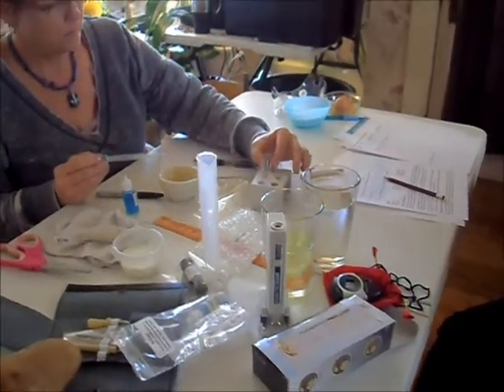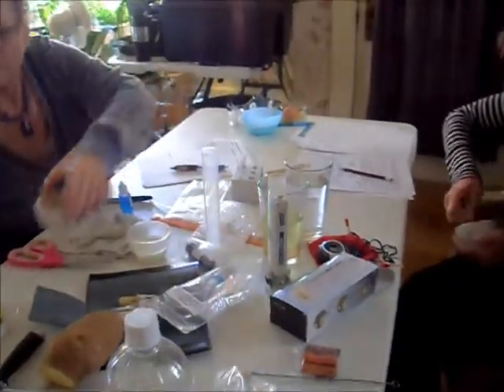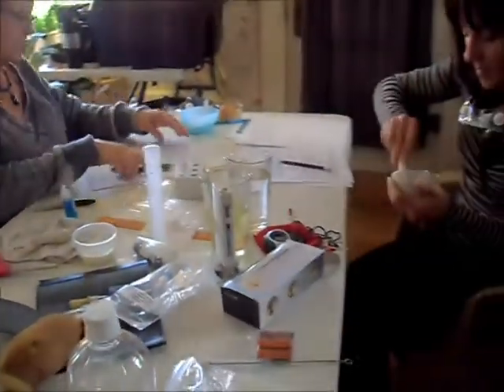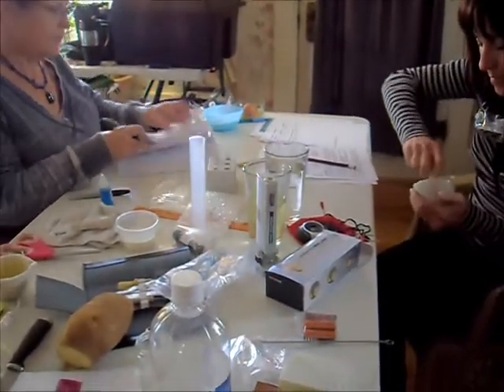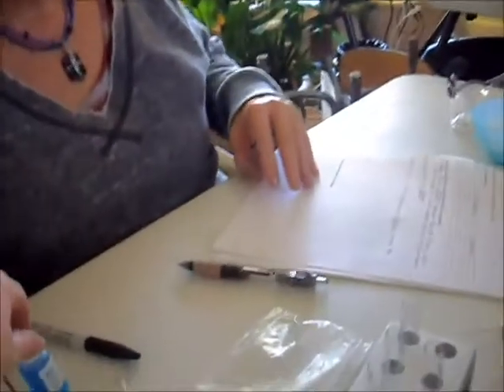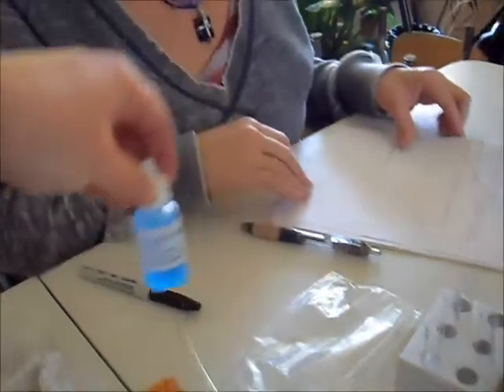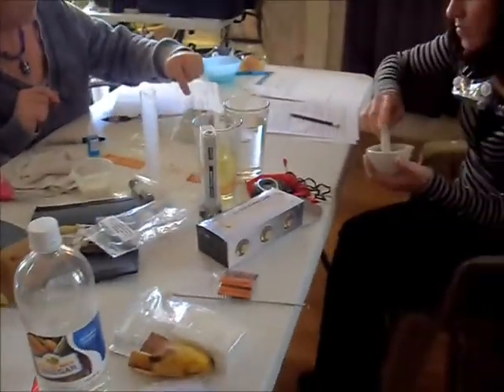We're working on the sugar test, and actually we're setting it up for the second time because we accidentally used the Biuret instead of the Benedict's solution. So this Benedict's reagent right here is for the sugar test, and the Biuret is for the protein test.